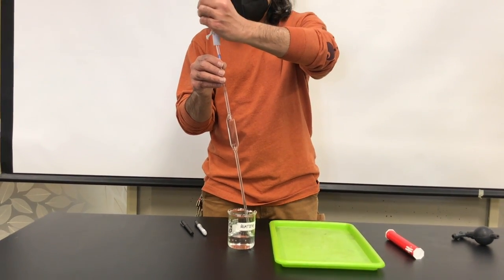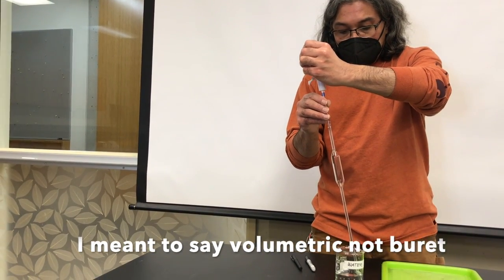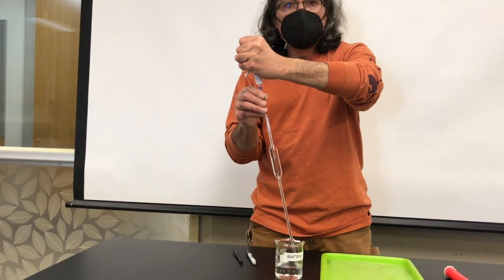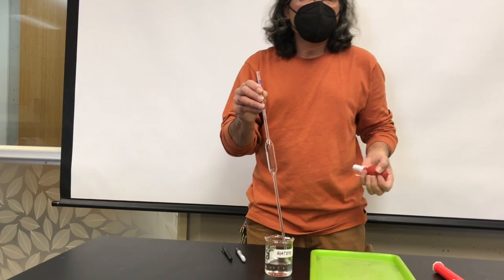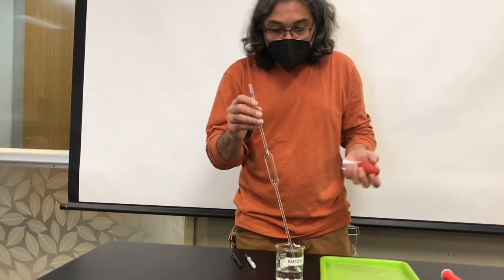So I'm going to squeeze. I don't want to squeeze when the tip of the beaker is on the reagent because then I'm just going to push a bunch of air bubbles through the reagent and sometimes that can be bad.